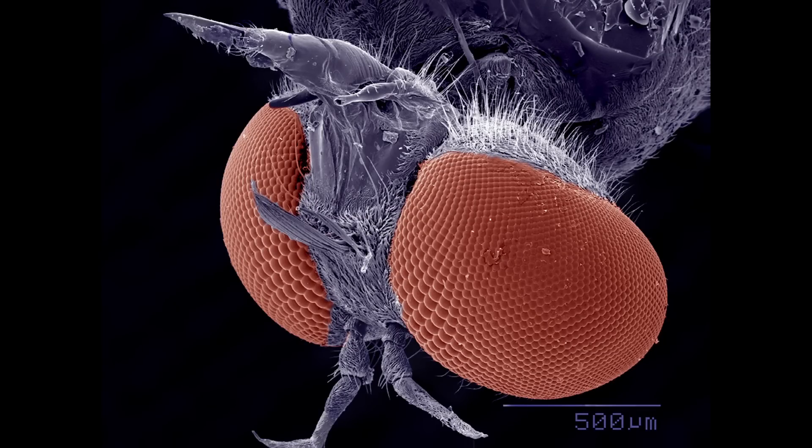But what I've not seen many people talking about is super-resolution microscopy. Which is weird to me, because x-rays are cool and all, but super-resolution microscopy is literally about using lasers to see things with visible light that are literally smaller than the light itself. Which, it sounds a little bit crazy actually if you've never really thought about it before.